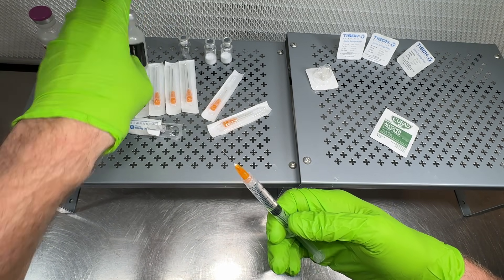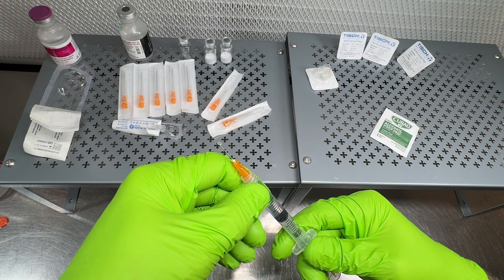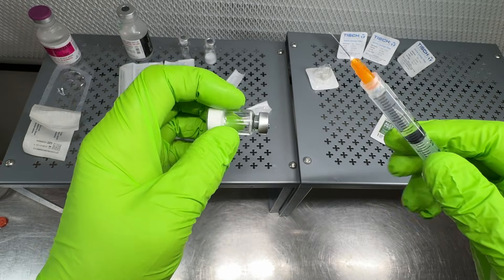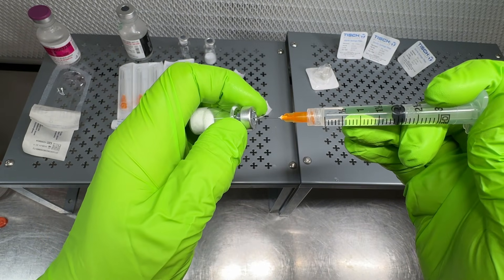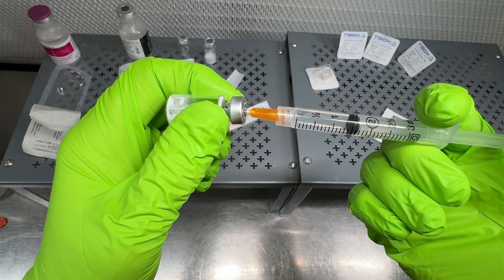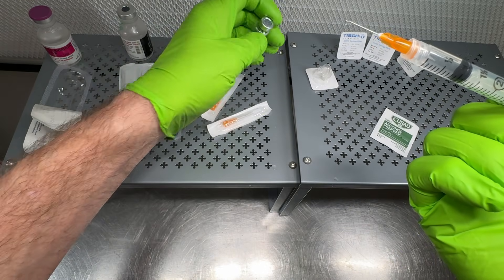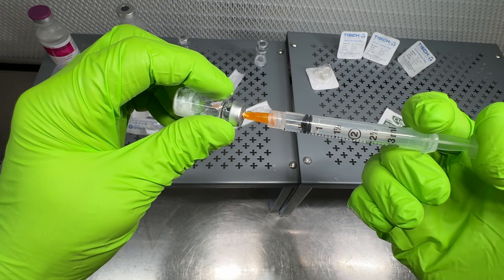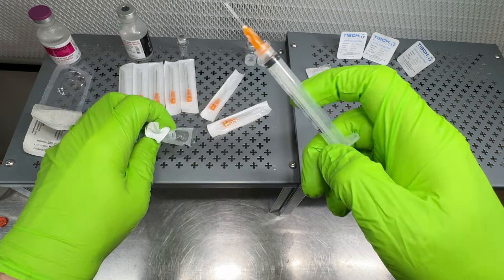I've got a clean workspace, everything's wiped down. Now, be careful when inserting the needle because the vial may be under vacuum and will suck the liquid in quickly. Since I'm splitting it into two vials I have to hold it back. I'll push to one milliliter in the first vial, pull that out, and put the other half into the second vial. Normally you don't want to cross the needle between different vials, but since everything will be filtered anyway it's not a big deal.